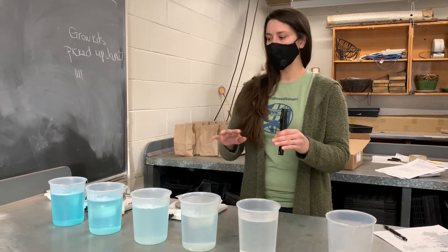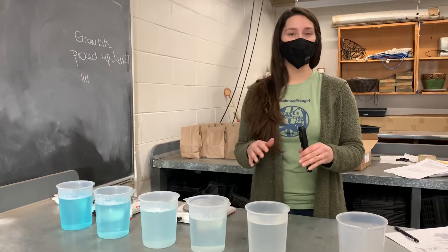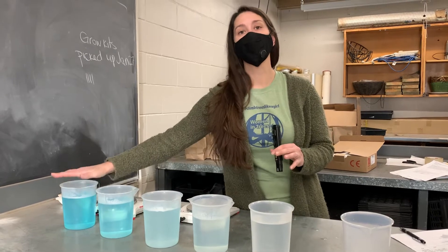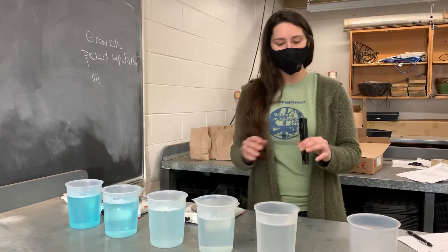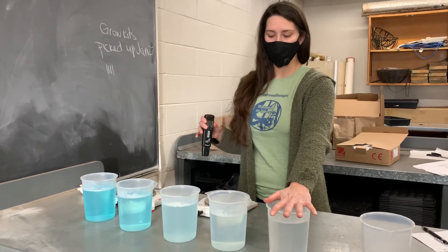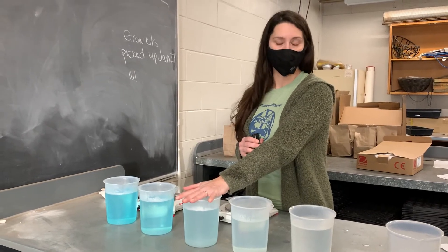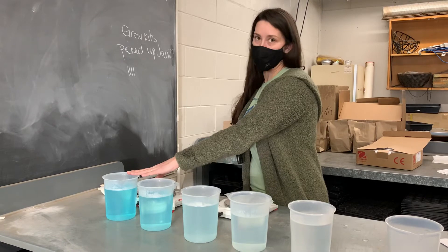Then we can mix various rates, do some measurements on those rates, and figure out if we went to maybe five times the normal rate, would we be looking at a lethal rate for our seedlings. What we've got here is water — just straight water — we've got half our normal rate, we've got our normal rate which is 100 parts per million nitrogen, three times normal, and five times normal.